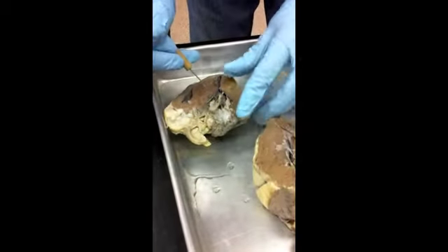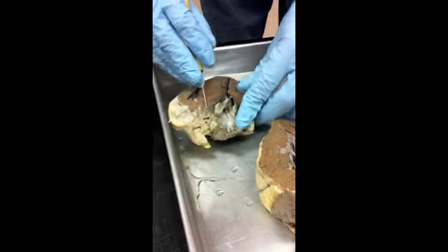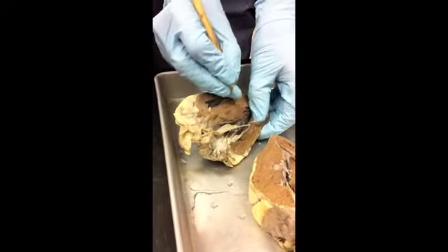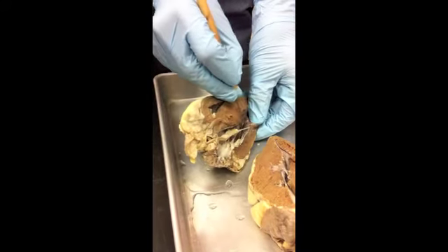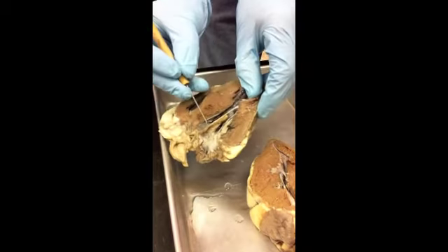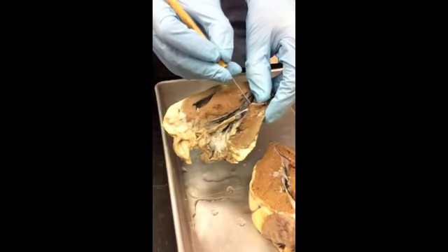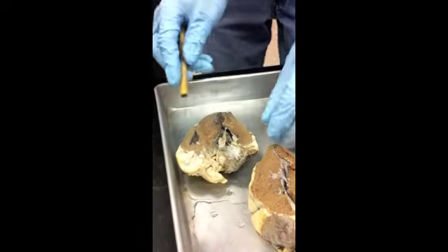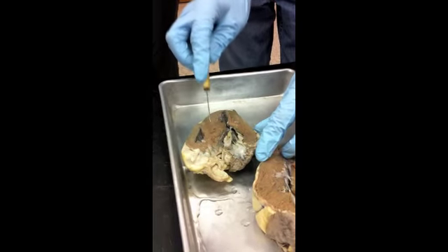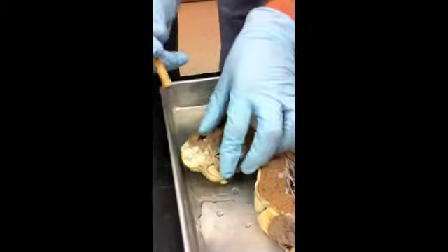Okay, and coming down from this valve, you can see these cords. Those are the chordae tendineae, and they come down and attach to papillary muscles, right? These are all converging and coming down here, so this would be a papillary muscle right there. I don't know if everybody can see that or not. Chordae tendineae coming down from this valve, attaching to a papillary muscle. Since these are both ventricles, and this is the wall that's dividing them, this is the interventricular septum.